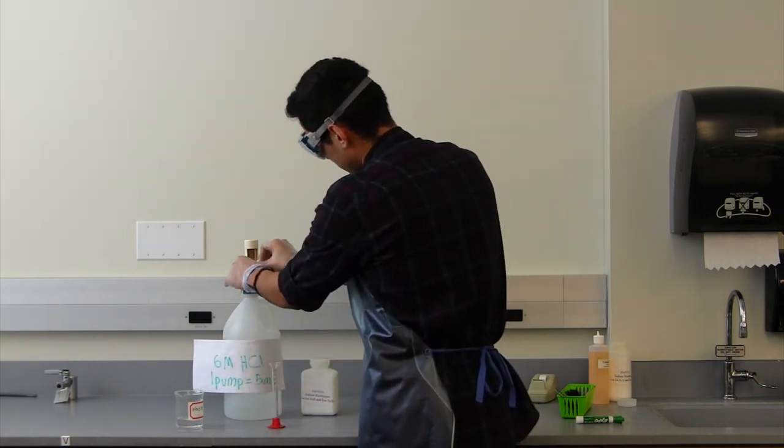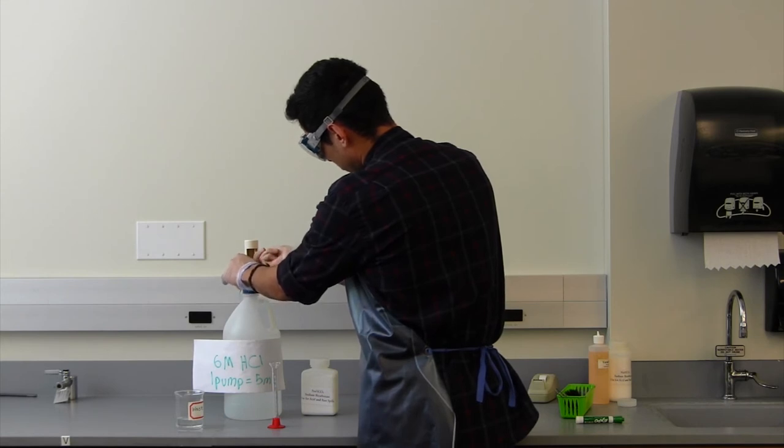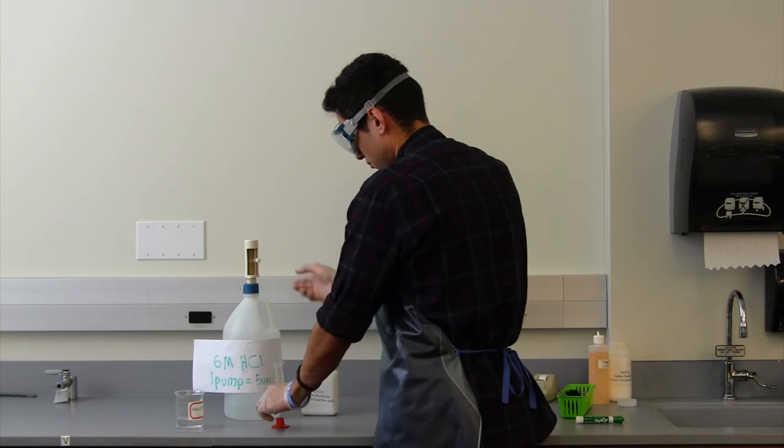Another mistake is caused by one student affecting the volume adjustment knob and having subsequent students pump from the maladjusted knob.